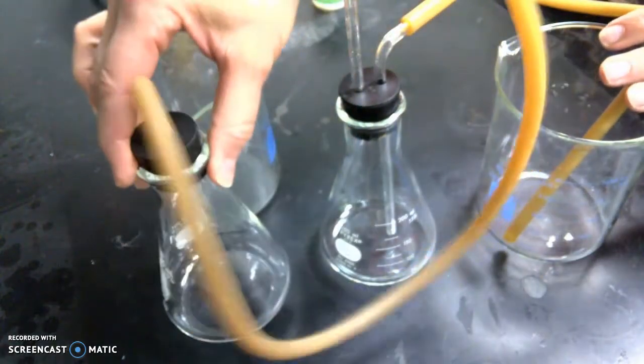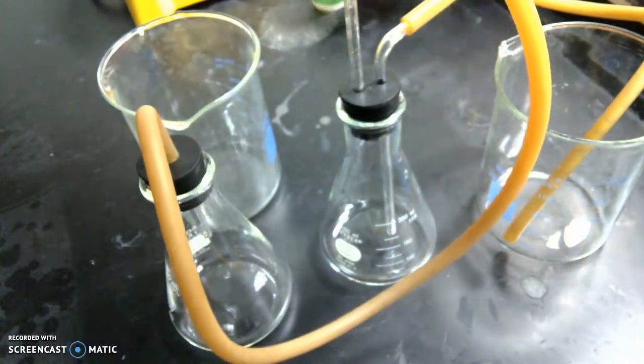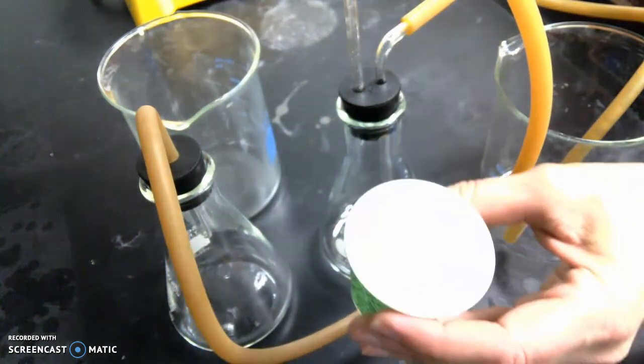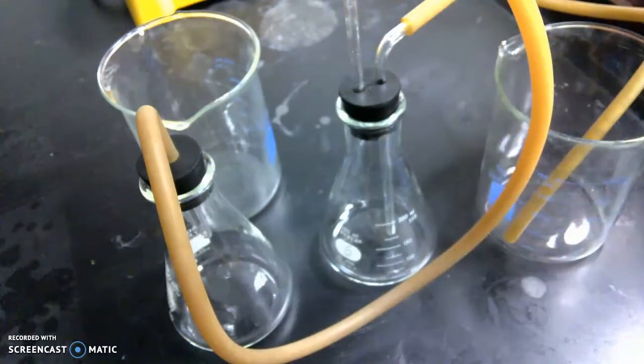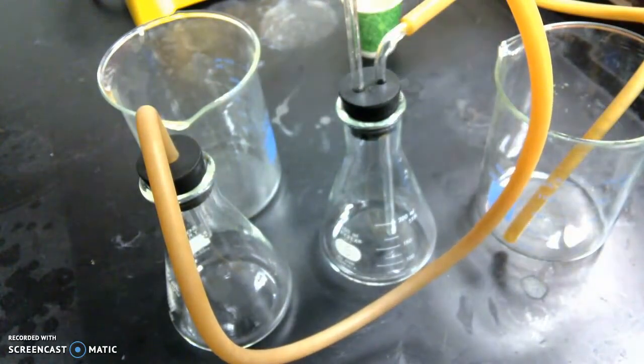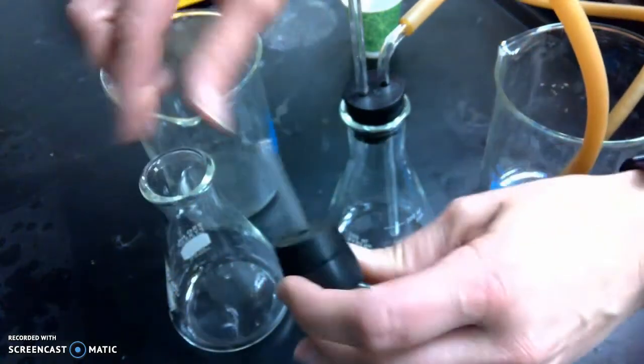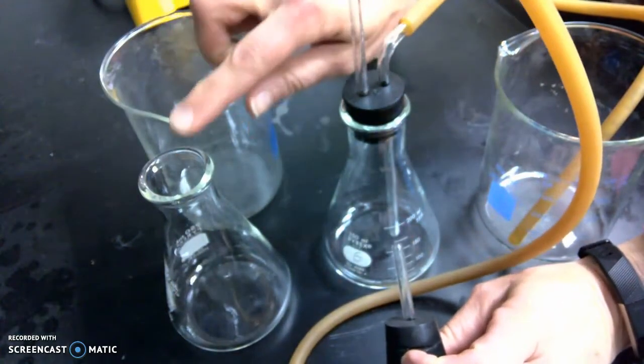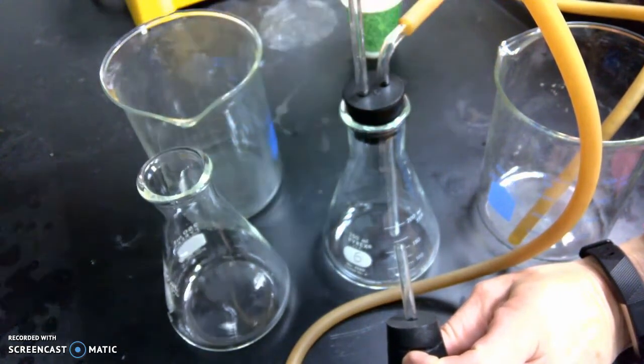This is going to be where you're going to put the chemical and the two chemicals that you used. One's going to be in a Dixie cup. You have the solid CaCO3, and then you have your hydrochloric acid. You're going to fill the reaction. You're going to measure and fill the hydrochloric acid in here, so you need about 20 milliliters of hydrochloric acid you're going to put in here.